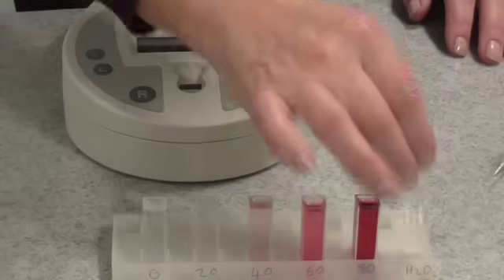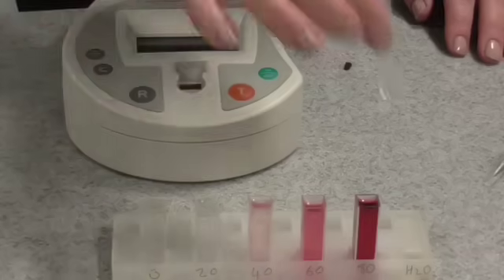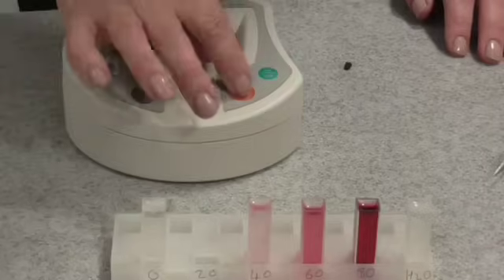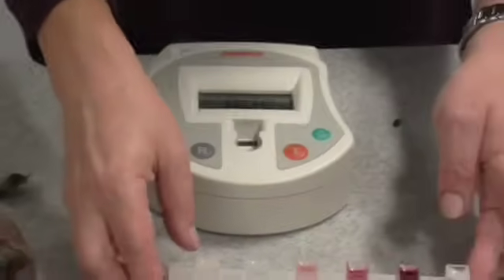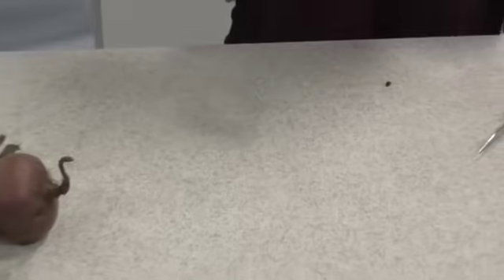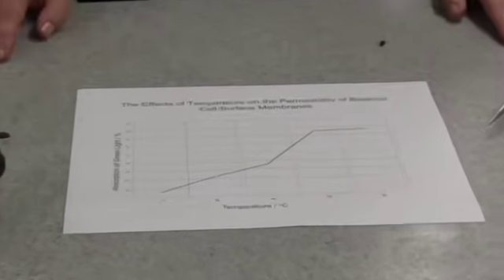We reset again and do our second sample, and we carry on until we've tested the absorbance of all of our samples. When we've done this, we can use our data to plot a graph to see the effects of temperature on the leakage of anthocyanin from beetroot cells.